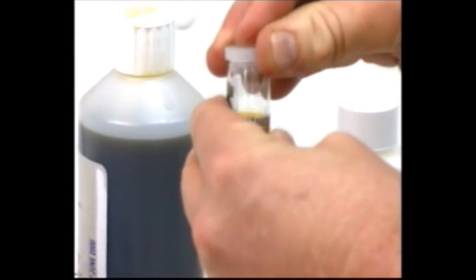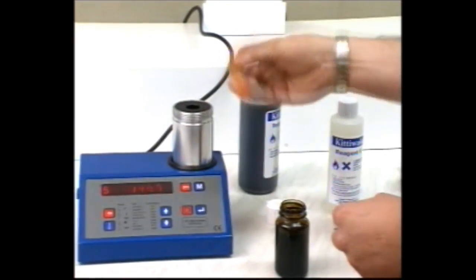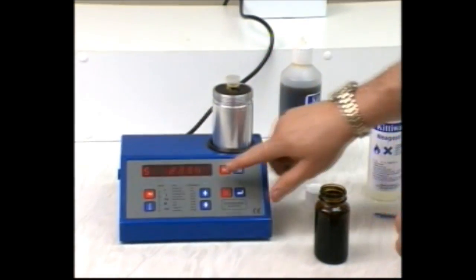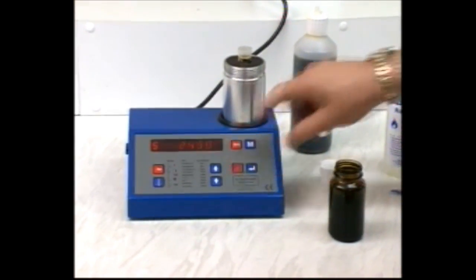Put on the cap and shake it well. If the oil has any TAN, the color will change to red. Allow any bubbles to settle and return the tube to the cell.